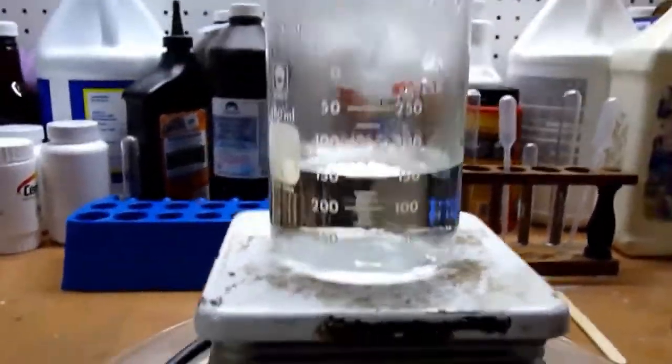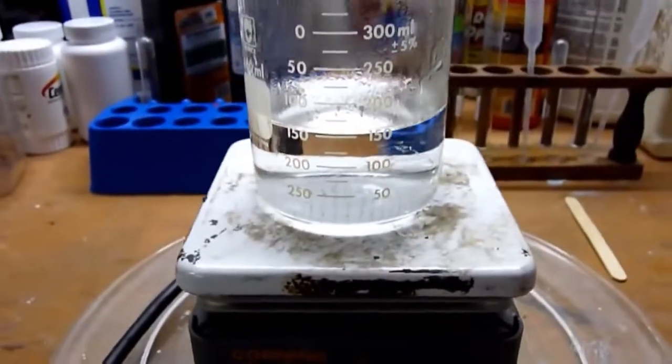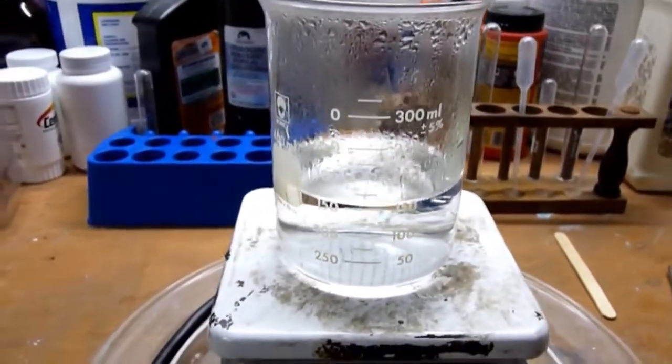Anyway, this is what it's supposed to look like and I will be back when it's down to about 25 milliliters, which is way down there. So, it should be another hour and a half or so. But it's nice because with this setting I can just leave it unattended. Alright.